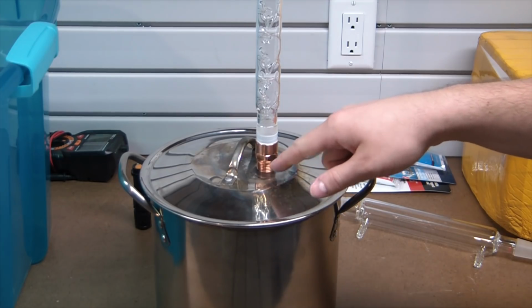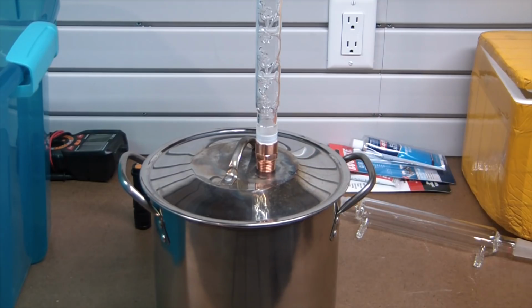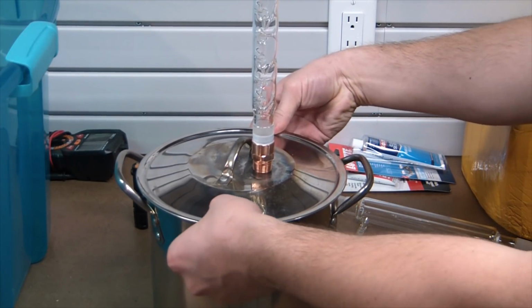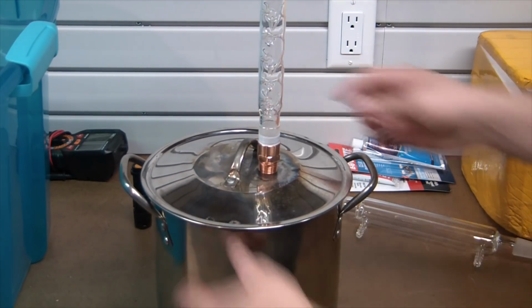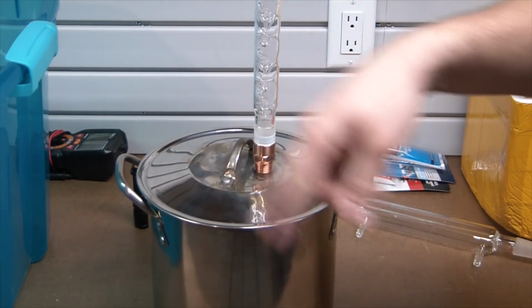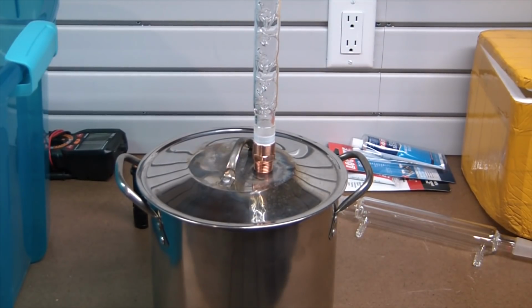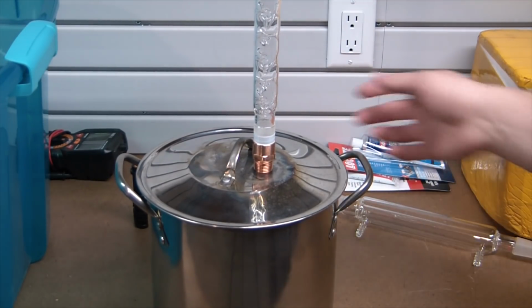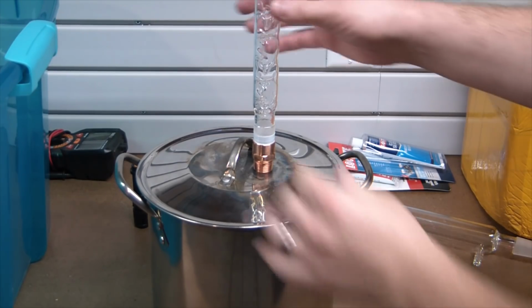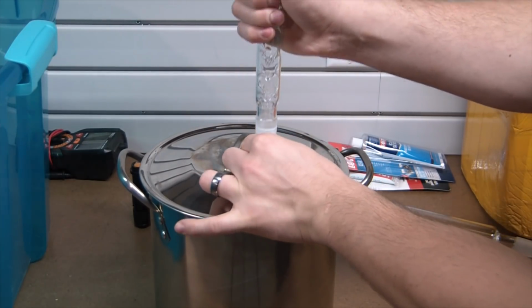So instead, I'm just using this threaded adapter, and what I'll do is seal that up with some flour paste, and that'll make a nice airtight seal there. Now for the clip here, to actually set this down, I'm just going to use a bunch of little binder clips. I'm going to wrap the top with PTFE tape, binder clip it, and that should give a good seal. If I have to, I'll use some flour paste around the edge, get it all sealed up, but should work nicely. You can see the glassware has a pretty good fit in there.